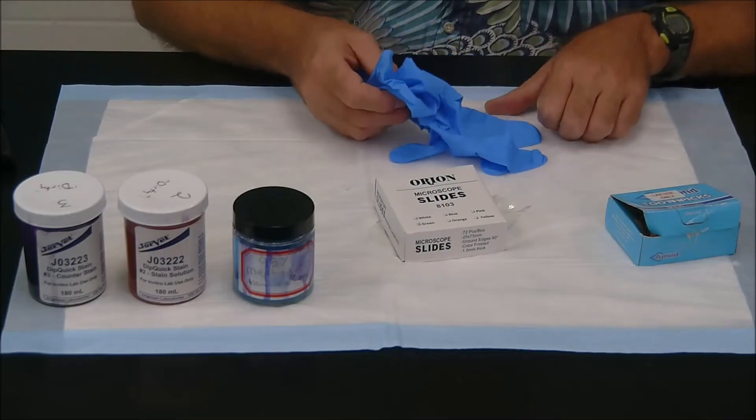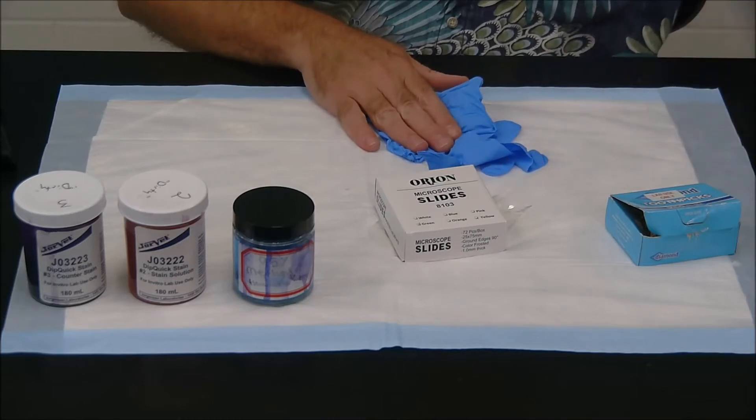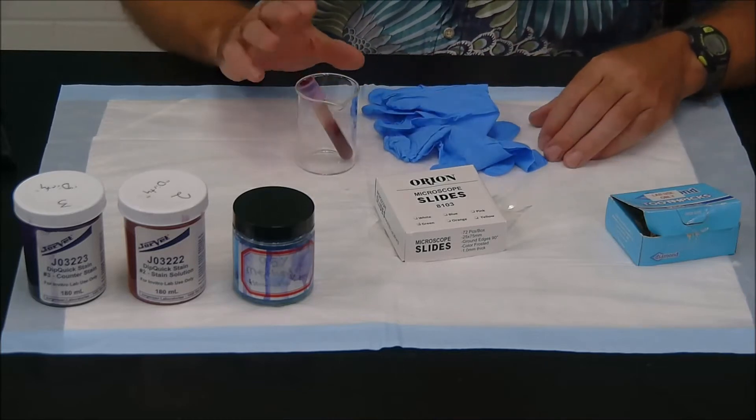Well, you're obviously going to need gloves because we are messing around with real blood. You also need your blood sample, which we have here. And again, this is canine blood.